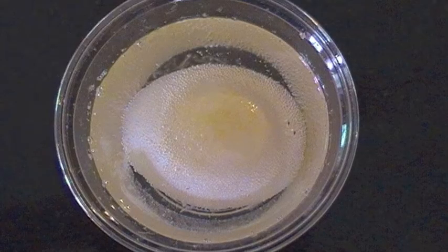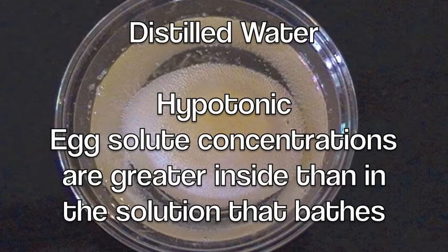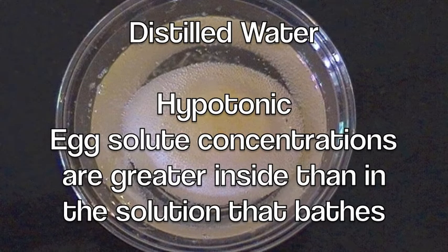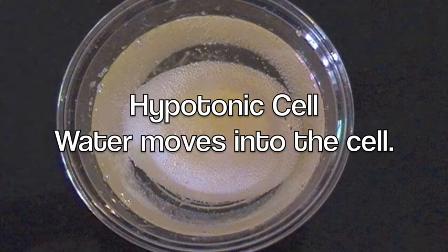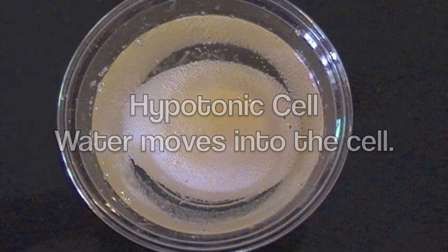The egg in the distilled water grew, indicating that it absorbed water. This is because it is in a hypotonic solution. Remember that cells in hypotonic solutions have solute concentrations greater than the solution that bathes them. This concentration difference causes water to move from the surrounding solution into the cell.